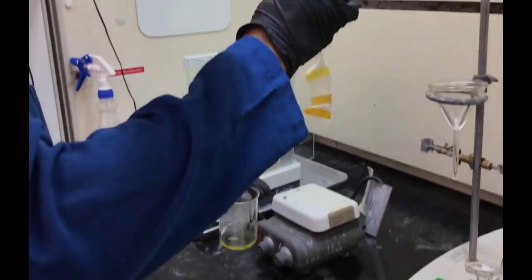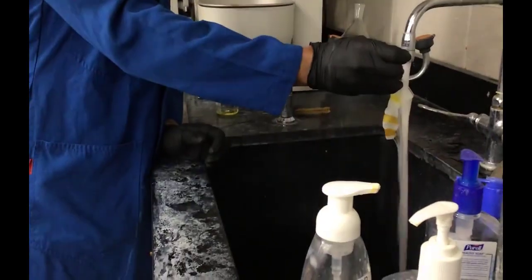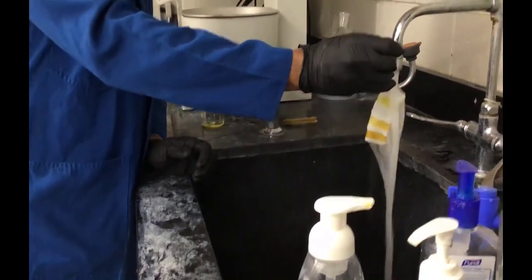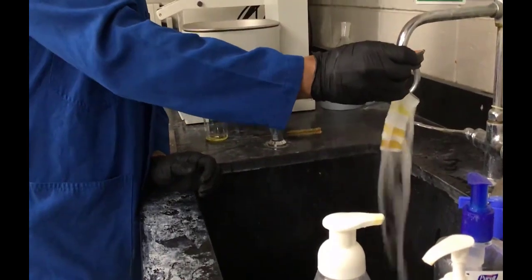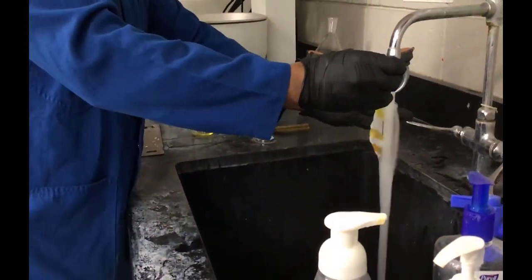All right, so now they're taking the cloth out after it cooled down to room temperature, and so you can see certain sections of it have been stained appropriately. Some are yellow, some are goldenrod. I mean, I dare say one of those colors might actually be orange. All right, and so they're rinsing it off with water.